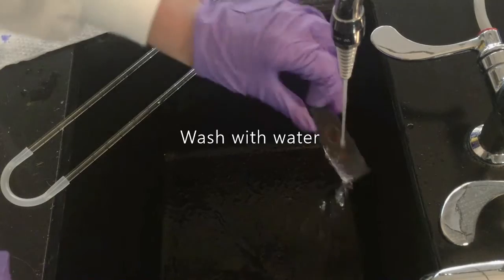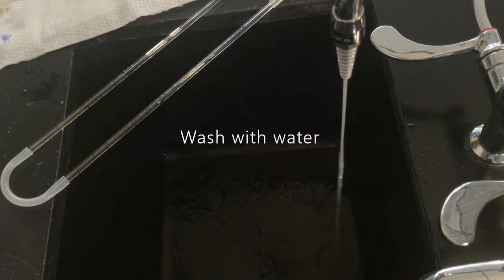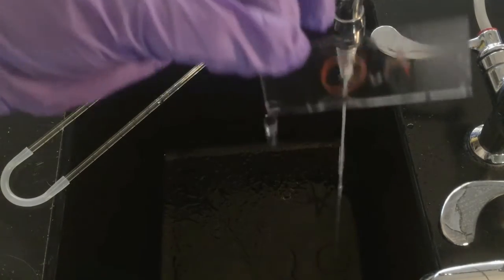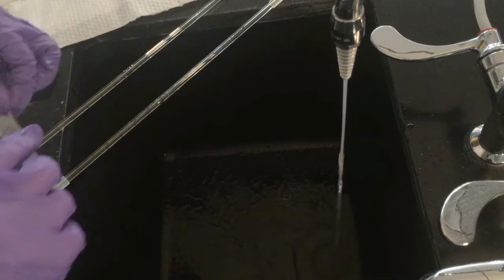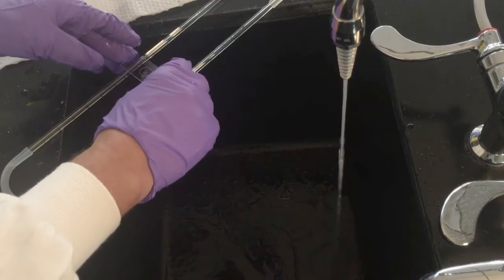I take a look at the slide. If there's too much purple on there—and I think our slide is actually looking pretty good—but if there were too much purple, I would do another ethanol wash step.